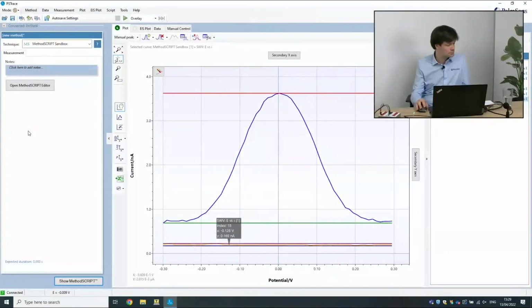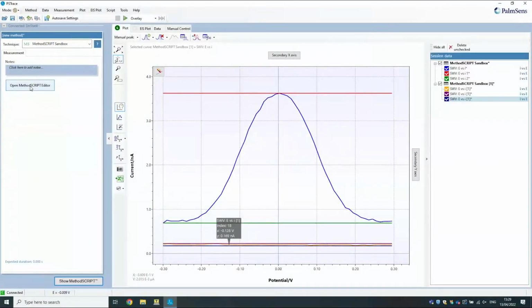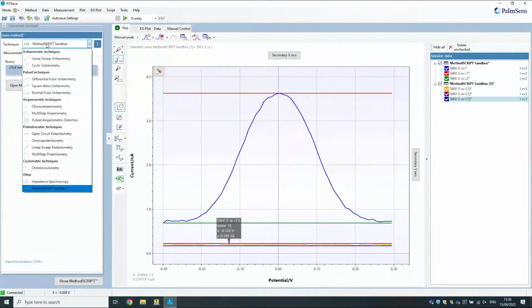Can you also do that with repeat loops? Or do you have to copy paste? Yes, and there's also a way to do that in PSTrace. I think that's already in this version, but it might be in the next.